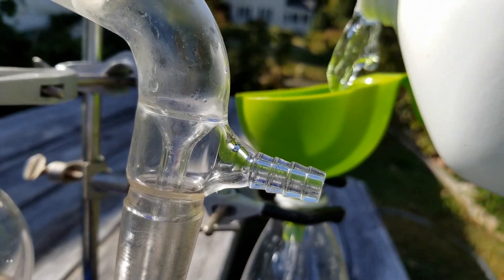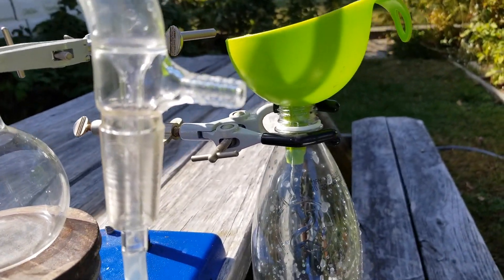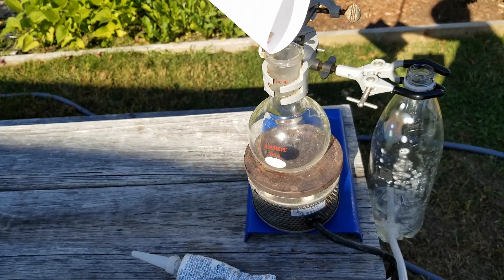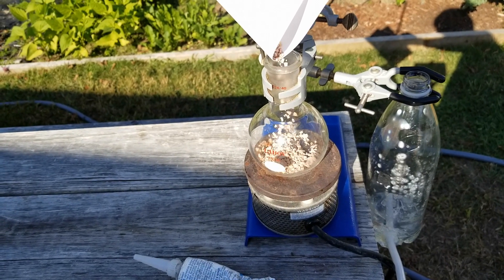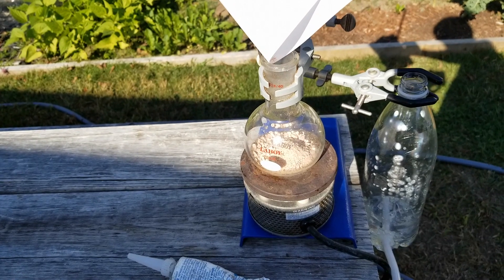In this clip I'm just adding some nice, relatively clean muriatic acid that I bought from Home Depot. Then I added some calcium chloride that I synthesized from seashells. You may see that it's a bit brown, and that's because it has impurities inside of it. But all the impurities are solid, so the distillation or evaporation shouldn't carry them over.